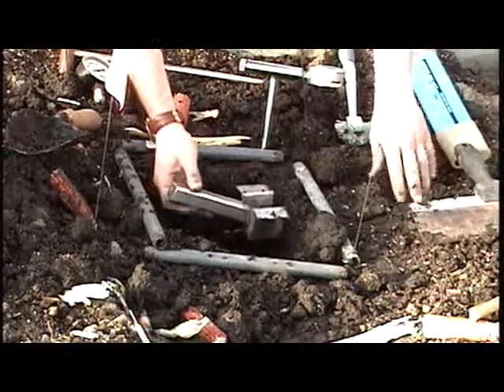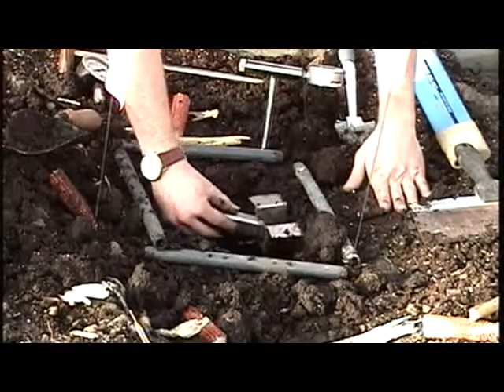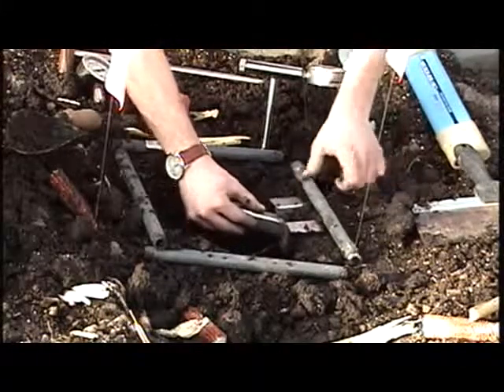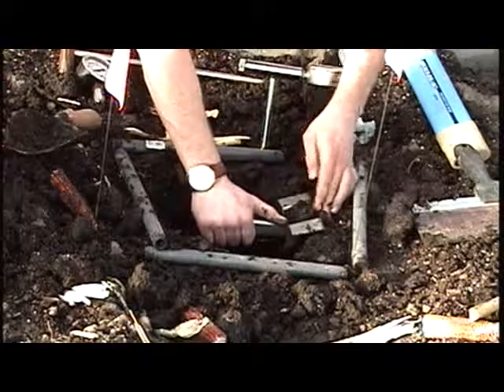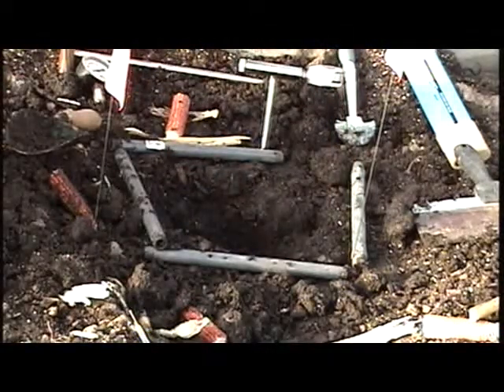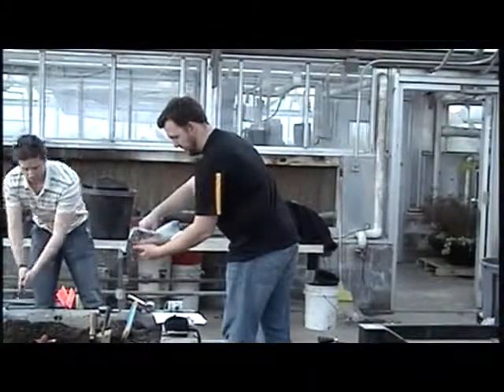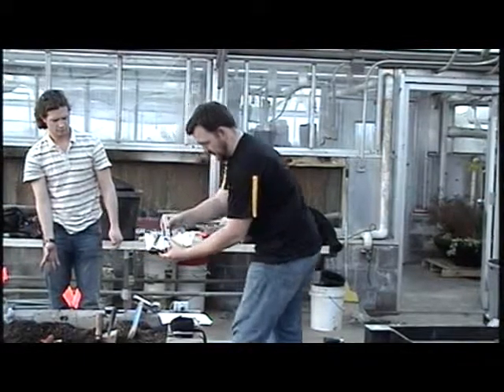Next, researcher 2 will take the 0 to 5 centimeter soil sample using a 5 cubic centimeter scoop. It is important to align the top of the scoop with the top of the soil surface. These samples will also be used to calculate bulk density. Therefore, it is important to collect exactly 5 cubic centimeters of sample without compressing the soil. Researcher 2 will then carefully hand the sample to researcher 3, who is prepared with foil to wrap the sample.